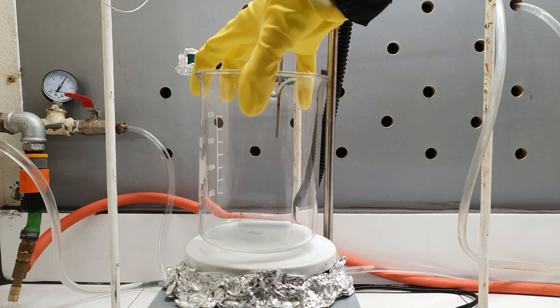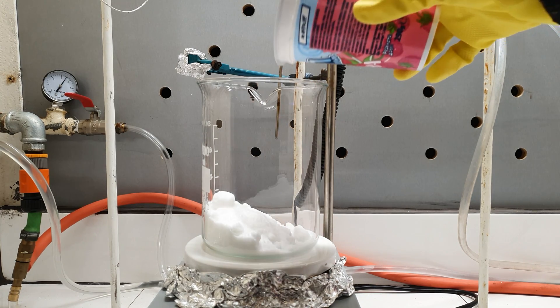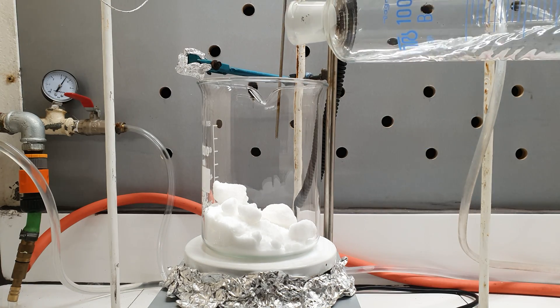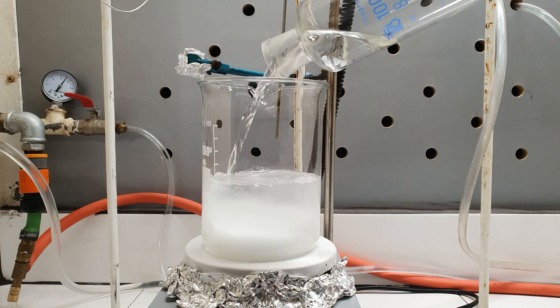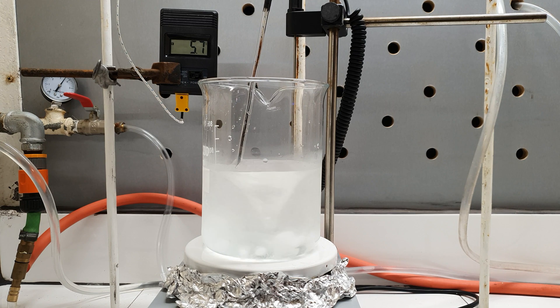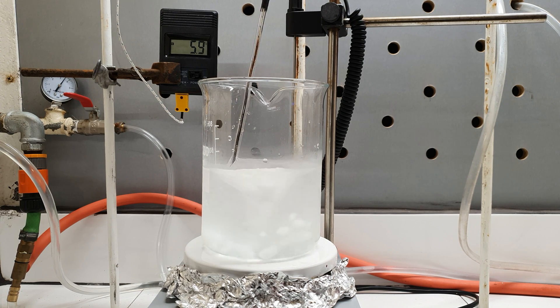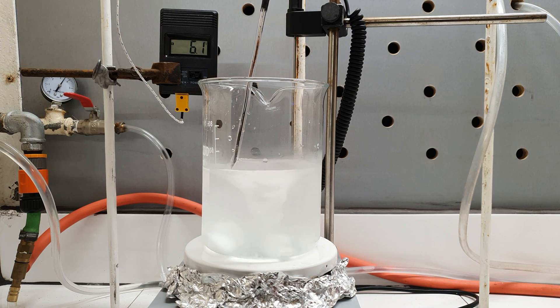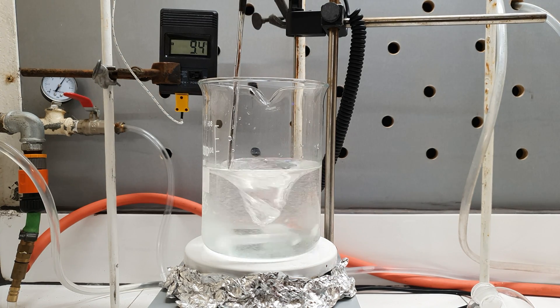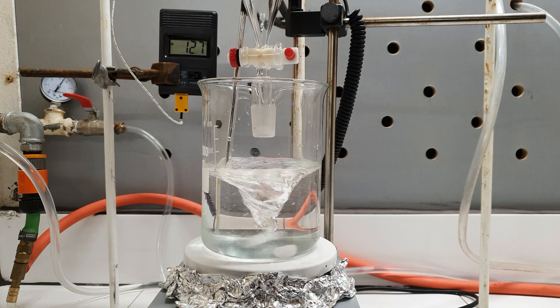I started by adding 240 grams of potassium bromide to a 1-liter beaker. To the salt I added 400 milliliters of distilled water. Stirring was turned on and the bromide started to dissolve. This step proved to be very endothermic — so endothermic that the solution's temperature can even get below zero. With the decrease in temperature the dissolution becomes slower, which would just waste time, so I turned on my hot plate to heat the solution and accelerate the process.